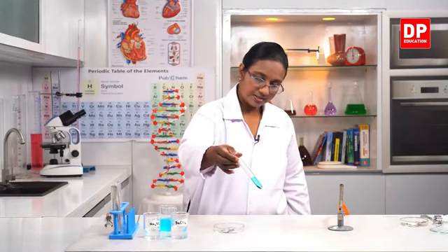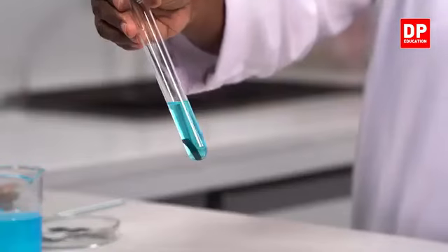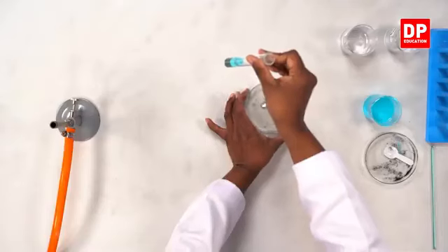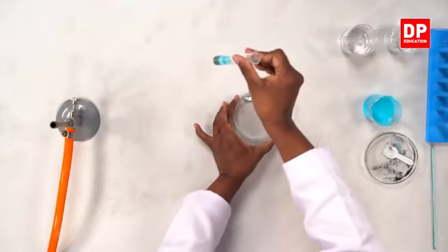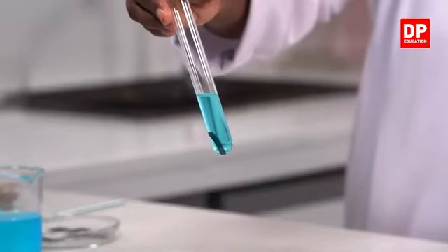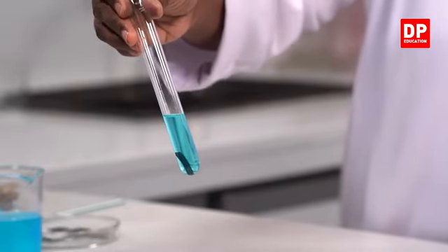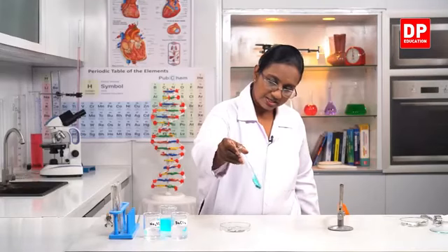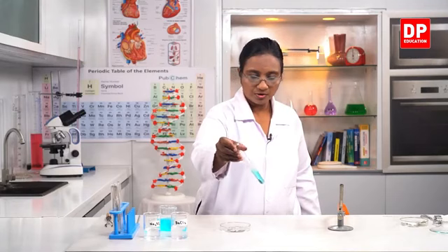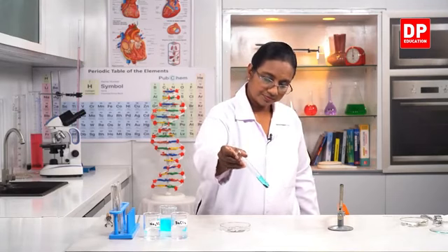You all can see the change taking place, students, but it takes some time. You all can see the color of zinc plate has changed. Initially, you saw it was shiny like this. Now you can see it has turned blackish in color. The shine is not there anymore. So that means there is a chemical change taking place. At the bottom, you all can see a small amount of solid substance depositing. Can you see that?